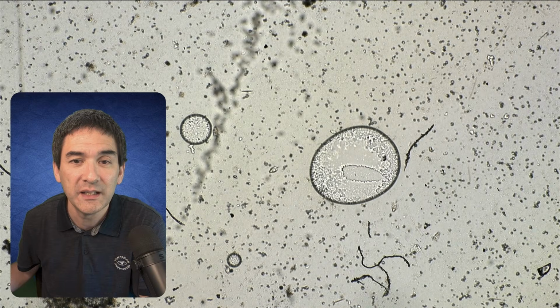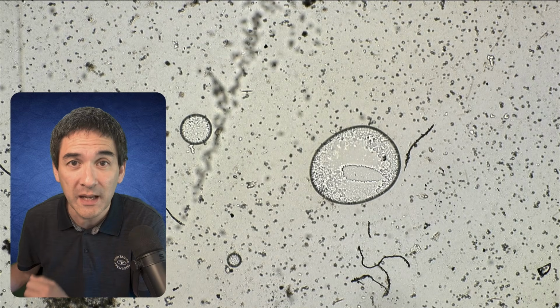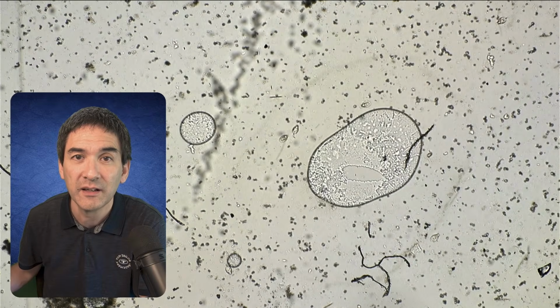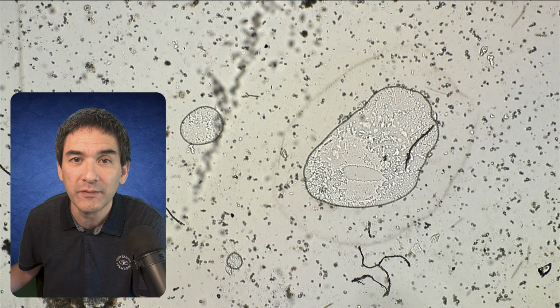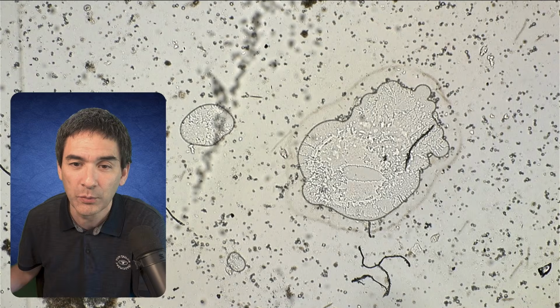So what you now see in the center are two air bubbles. And now look what happens when I'm scrubbing it. What scrubbing means is I'm fast forwarding the video. This has been pre-recorded. And look what happens. Can you see this ring forming around the air bubble? And now the ring is even contracting and moving inwards toward the air bubble. I can go backwards again, so I can move forwards and backwards.